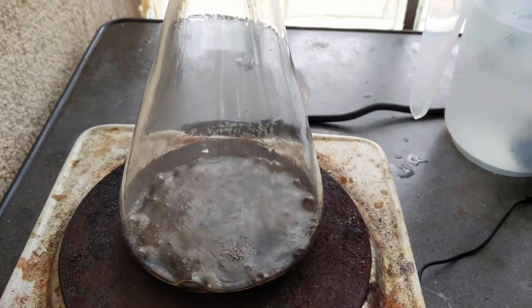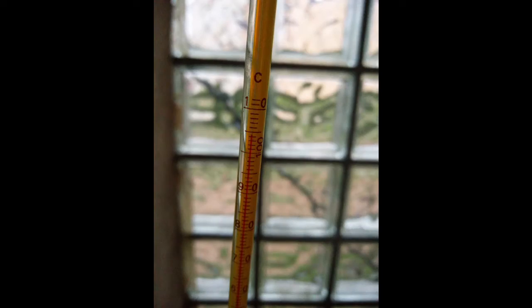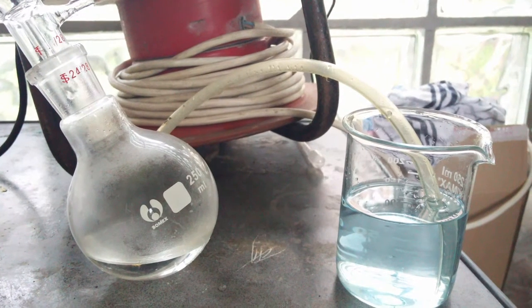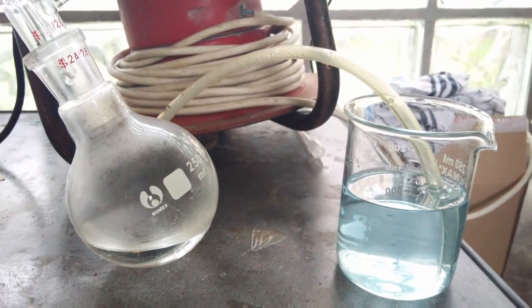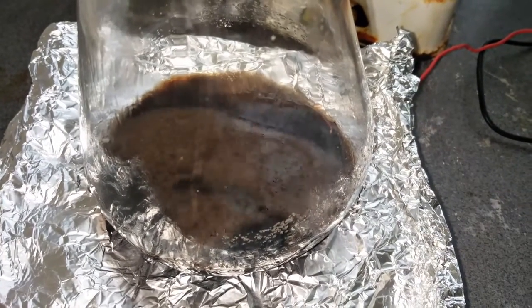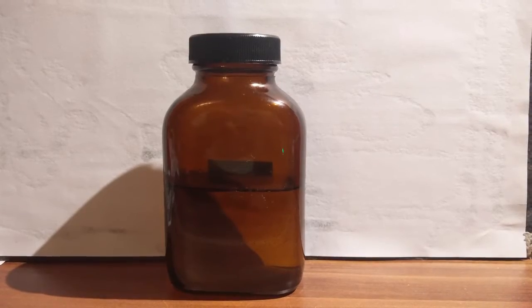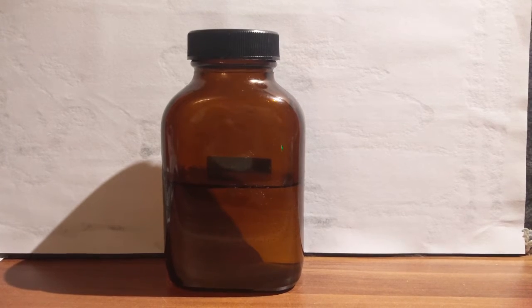It could be that dangerous side products like acrolein form, so pay attention to the thermometer — you can also see that the temperature rises, so stop heating the flask and let everything cool down. Don't forget to disconnect the hose from the vacuum adapter, because as everything cools down the pressure lowers and it could happen that your hydroxide solution is being pulled into the formic acid.